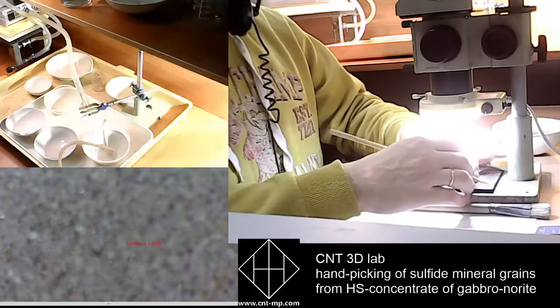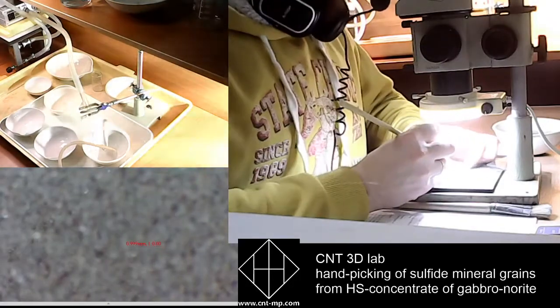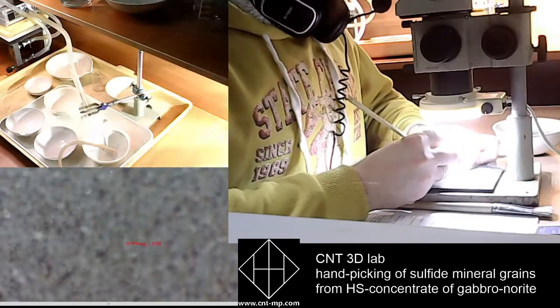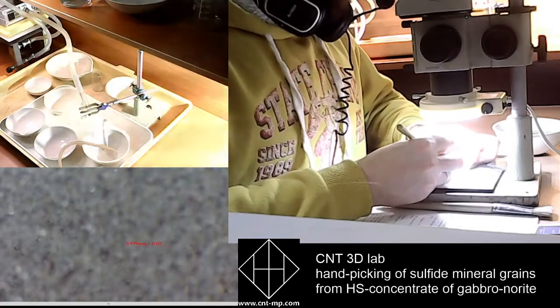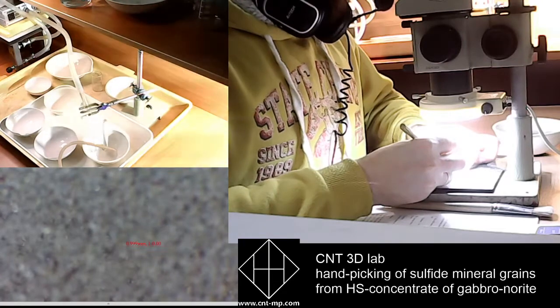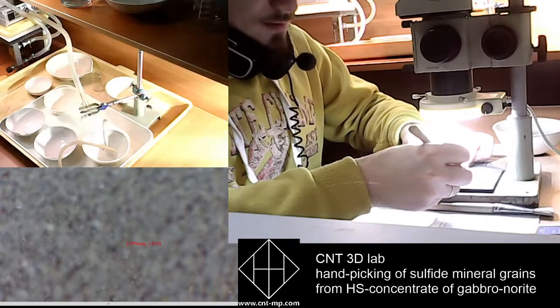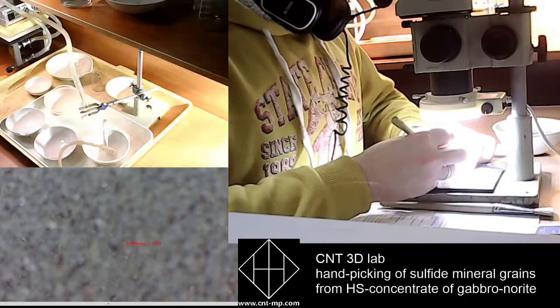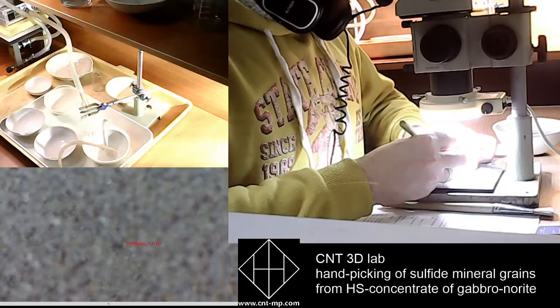Fragile, yeah. Some of them are fragile, mostly pyrite. I think this is connected with the genesis of this gabbro, alright? Because pyrite grains could consist of several crystals of pyrite, and when we touch them, they are simply crushed.